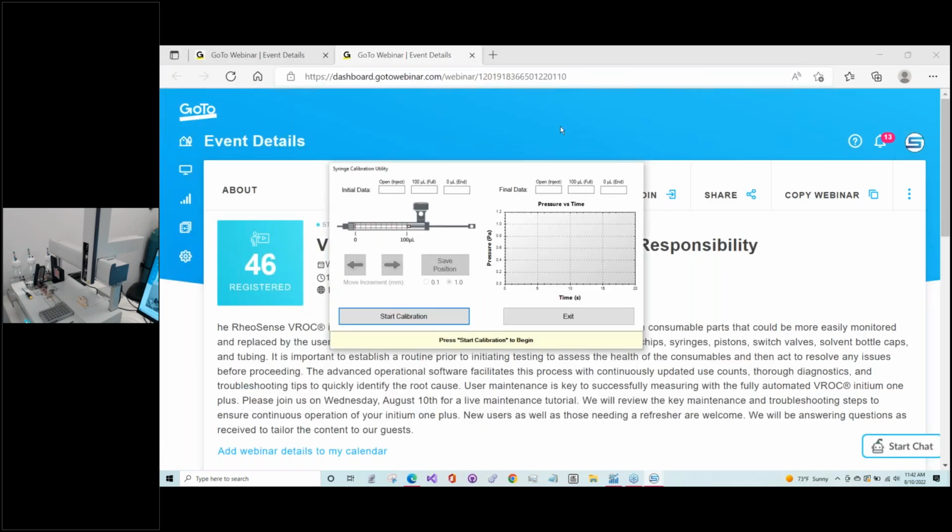Much of the calibrating of the test syringe is done automatically, although there is a portion that you will need to do yourself. So we'll go ahead and start it. Part of what it's doing is pumping air through different flow paths to confirm positioning of that piston in the test syringe so that during critical times, it's not blocking any paths. So it's in the right position during loading, and it's in the right position during, say, cleaning or purging of the cycle or purging of the sample.